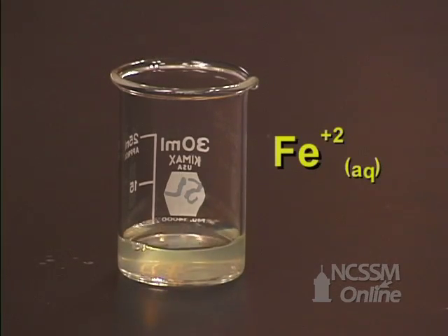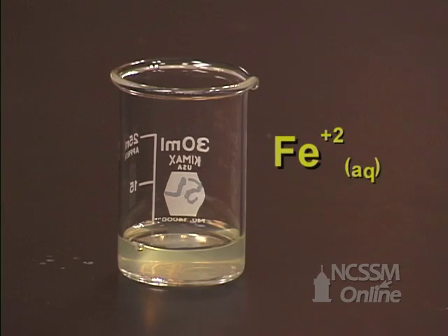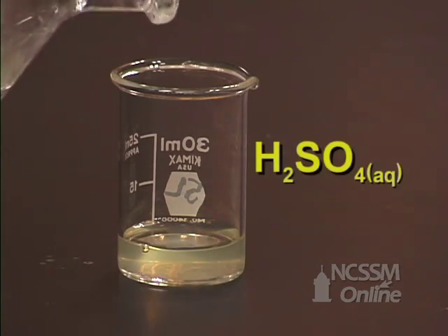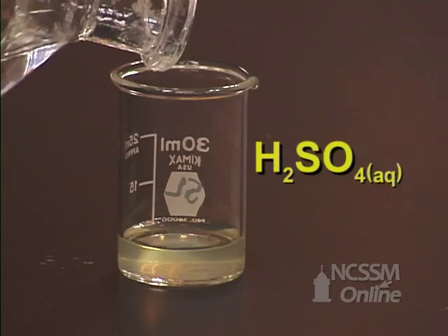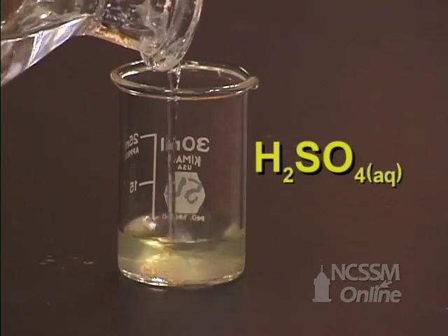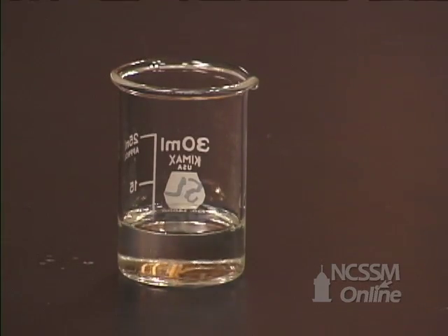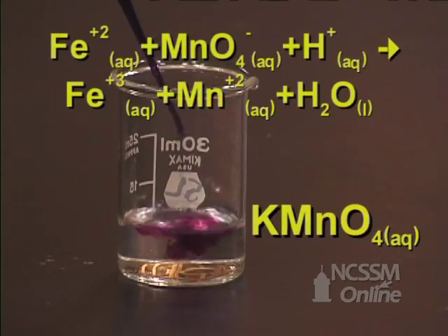We will add some iron sulfate to the beaker, then add some sulfuric acid to the solution, and then slowly add some potassium permanganate.